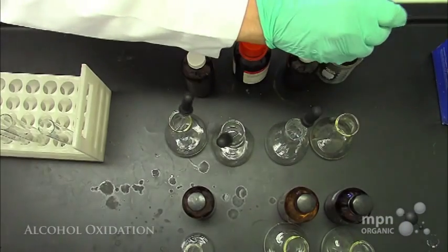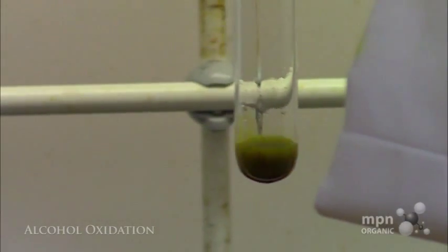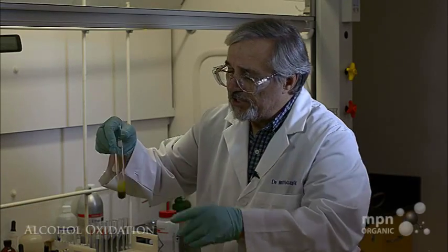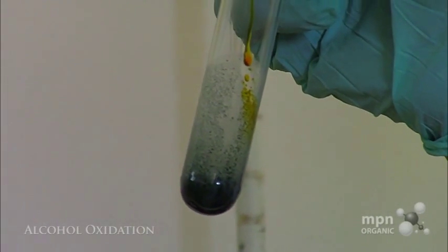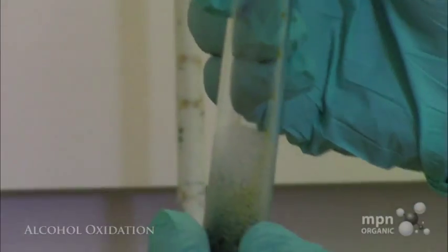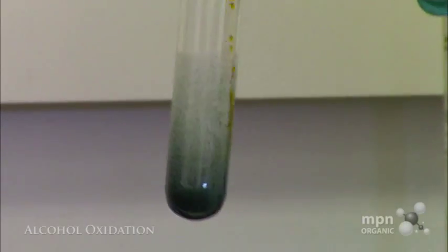And so let's take our chromic acid once again and see what happens when we drop a little bit in there. You can see that almost immediately we get the signature reaction, namely the reduction of the chromium +6 oxidation state to chromium +3 ion, formation of this nice bluish green colored ion, and the discharge of the orange-brown chromic acid.